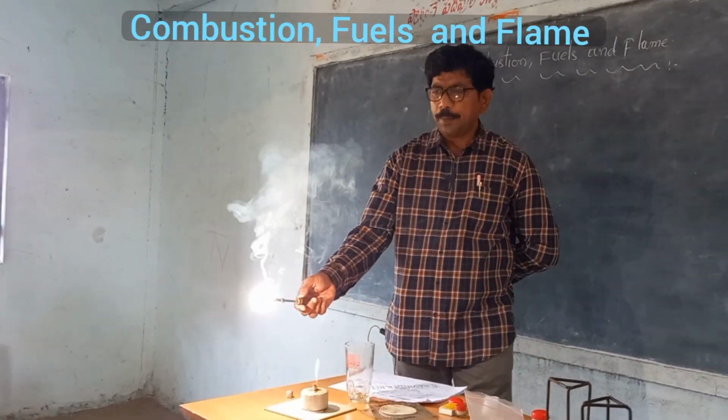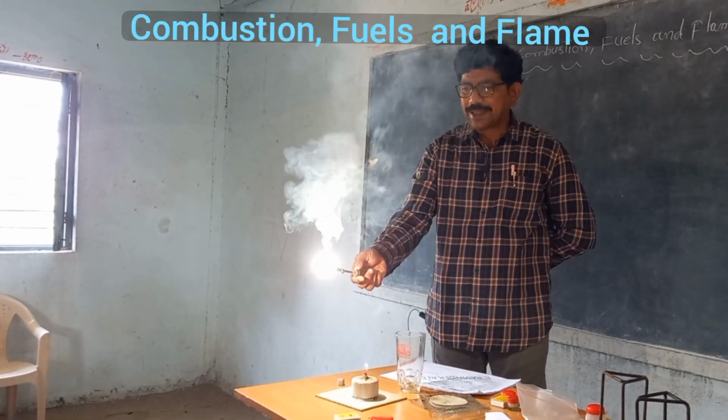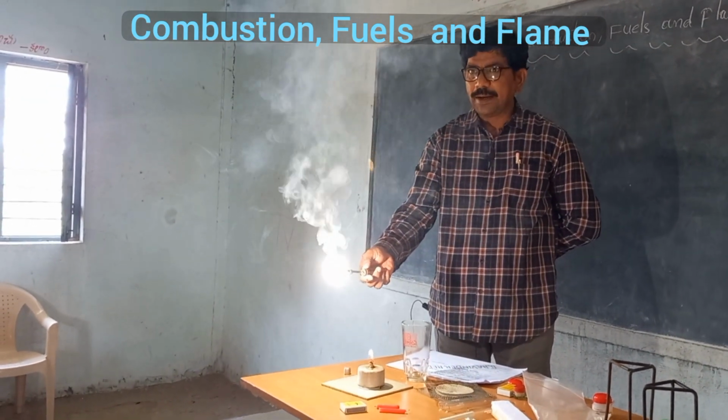See this? Magnesium is burning with dazzling white light.